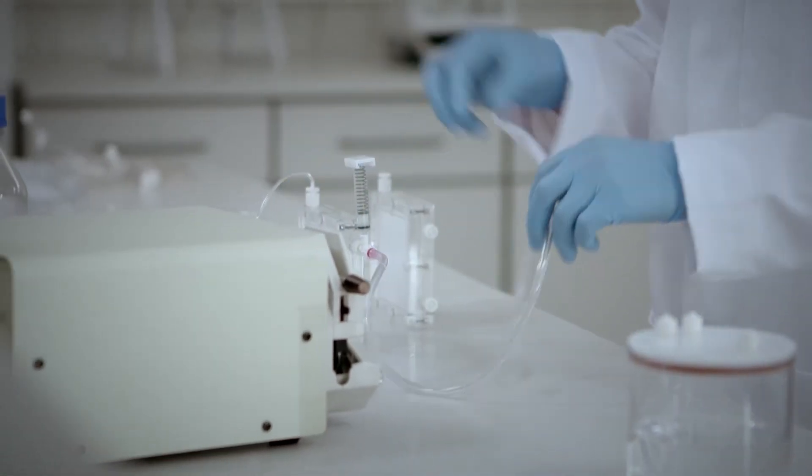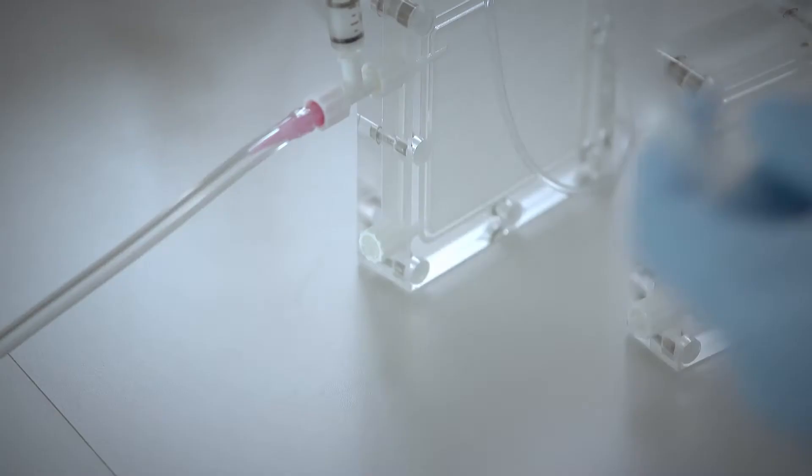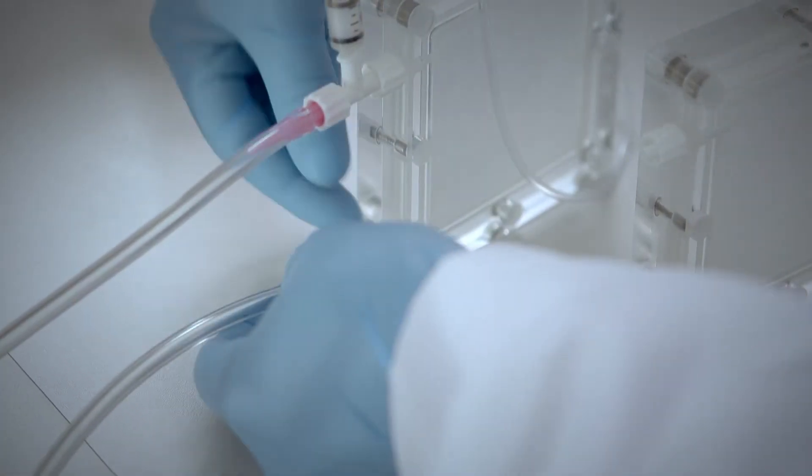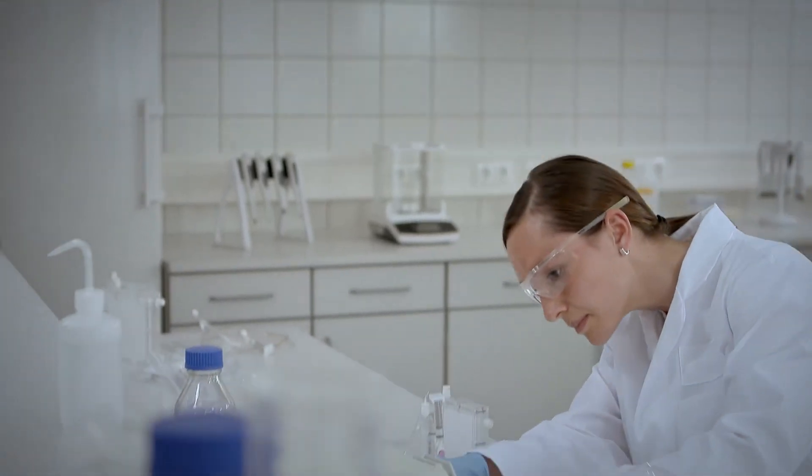To start a concentration run, first connect all individual components of VivaFlow 50R with one another, and in the next step attach to the diafiltration reservoir that holds the sample.